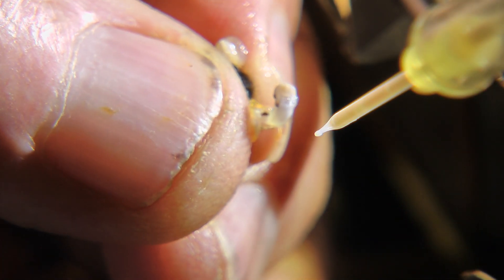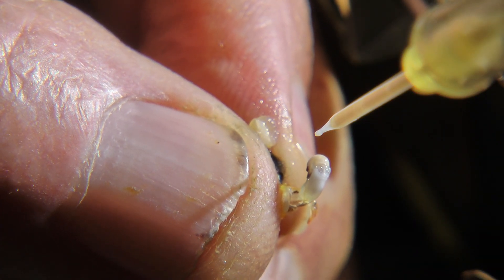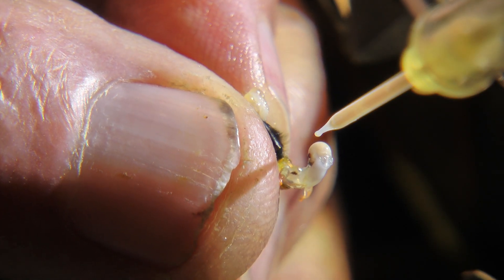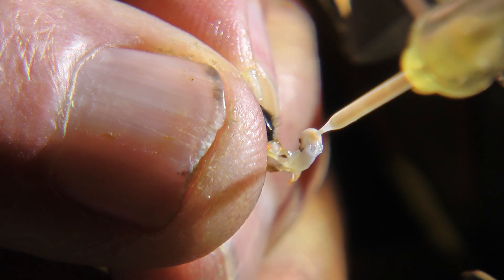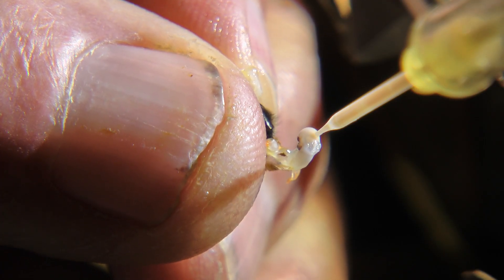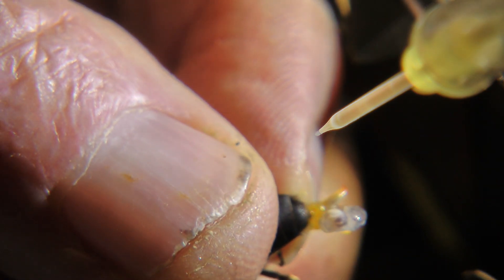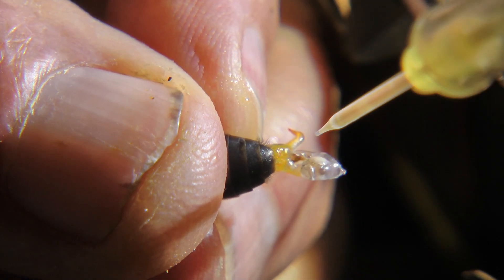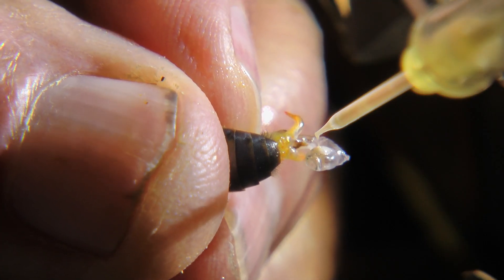That one doesn't have anything. I don't know if there's much to get from this one — maybe a little bit. It has little specks in it.